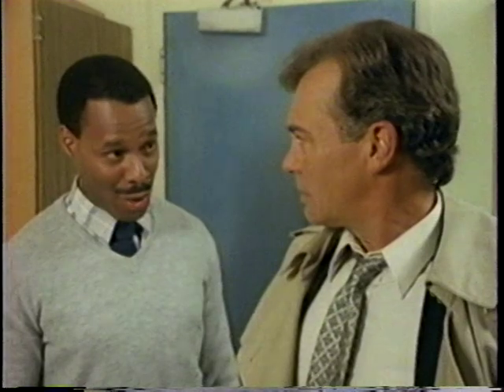Yeah. And there are spills. And slips. And falls. This place is a death trap. No, not at all. It's perfectly safe, as long as you pay attention and do things the right way. It's like I always tell my students, be alert and proceed with caution. Makes sense. While it's extremely unlikely, accidents can happen and people can get hurt. And they must take the proper precautions to see that they don't.